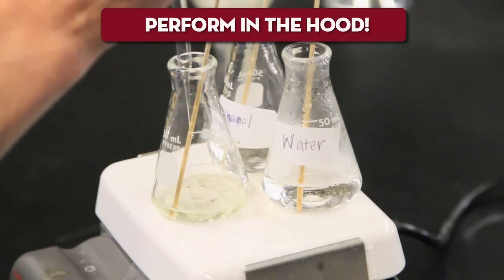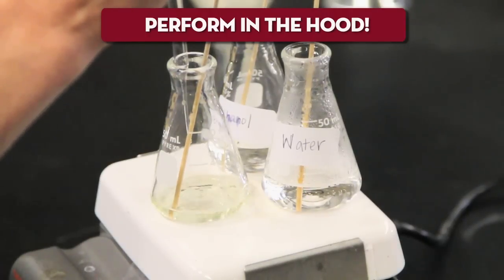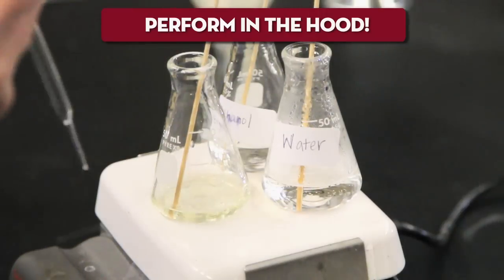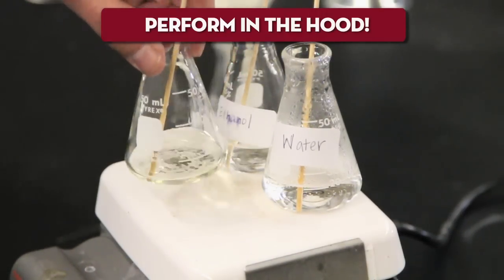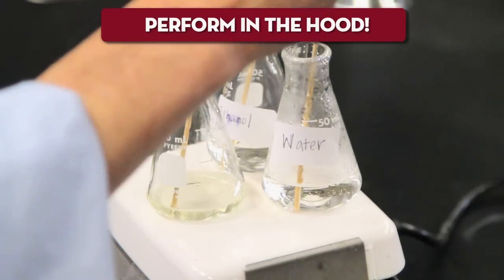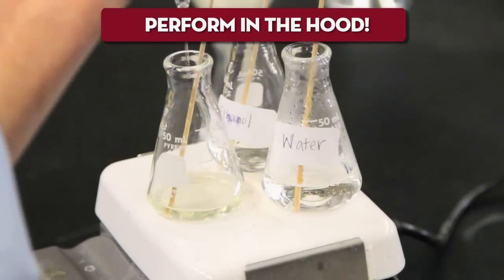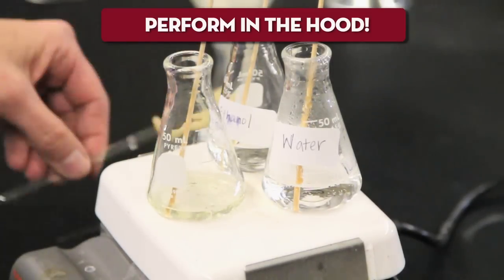Can you see that? You can see a little bit of cloudiness and then it's dissipating. You don't want to add too much of the insoluble solvent so it turns completely cloudy — you just want to add enough. I know I'm close to the right point here because it dissipates within a few seconds.